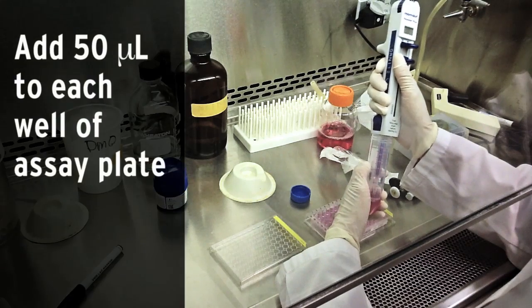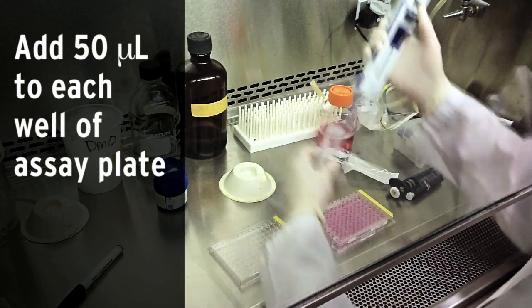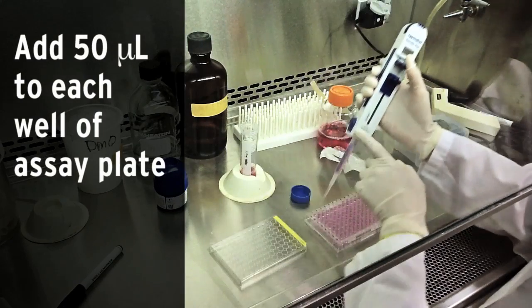Mixed by pipetting up and down, and then 50 microliters are pipetted into each well of the assay plate.